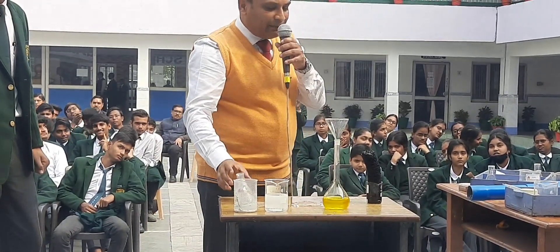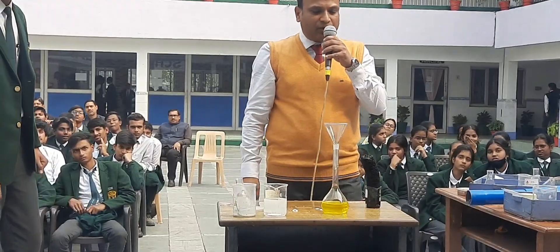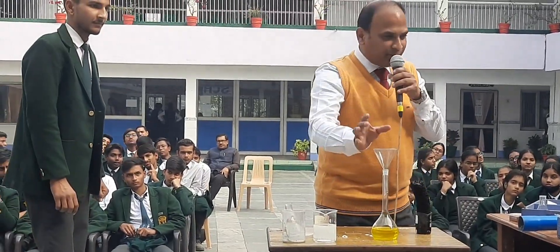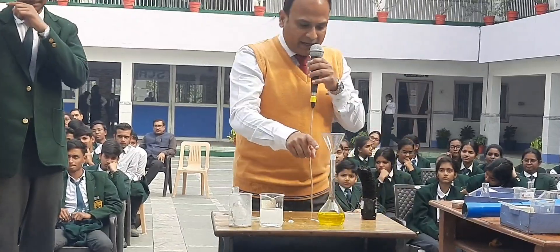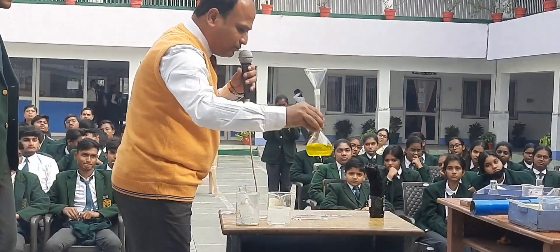What has happened? The color has changed from orange to yellow. All right, clear? All of you? The color has changed from orange to yellow.